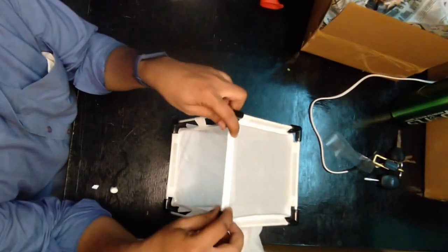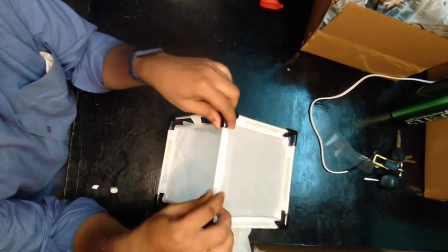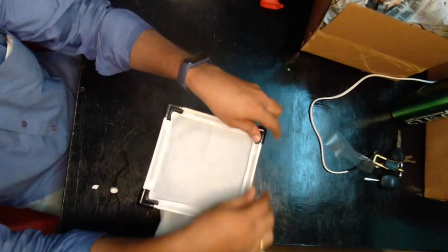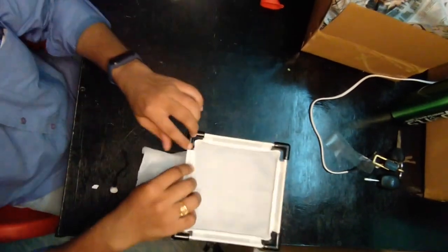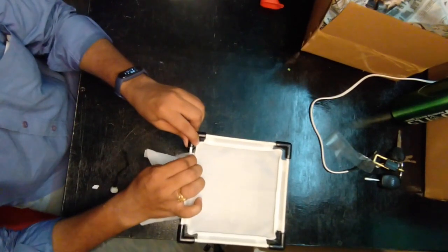While you are unplugging or dismantling the insect cage, please do not pull at the tightened part. You have to find out the loose parts. If you think this part is very difficult to untie, do not force dismantle the cage.